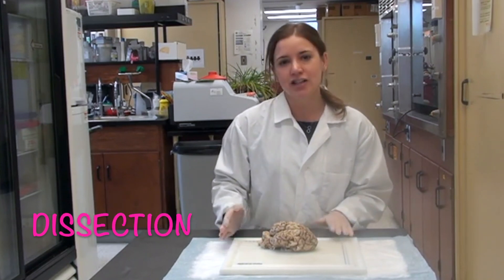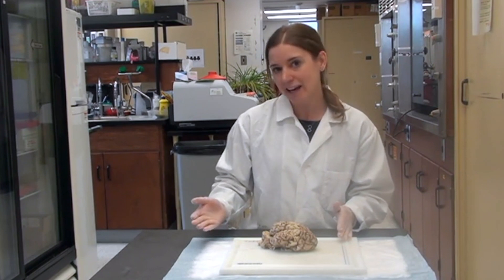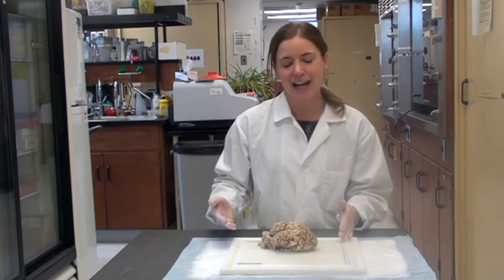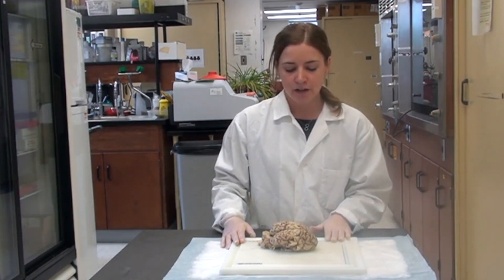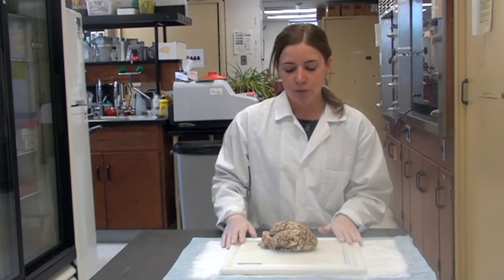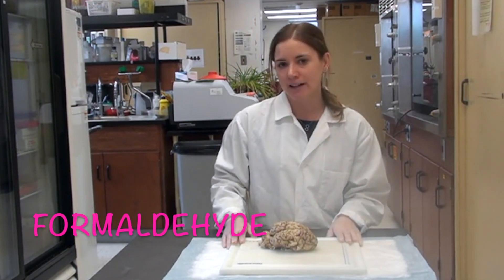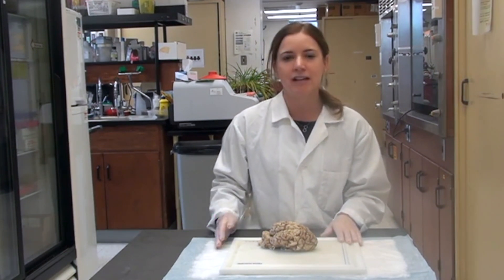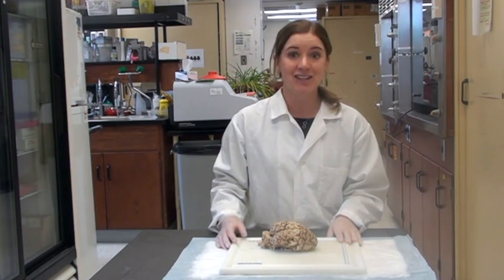So today we're going to do a dissection. Dissection just means that we're going to carefully cut up a biological thing — in this case a cow brain — so that we can study its parts. This cow brain came from a butcher and we prepared it by soaking it in a chemical called formaldehyde, which keeps it from decomposing and makes it firm enough that we can actually handle it. So let's get started.